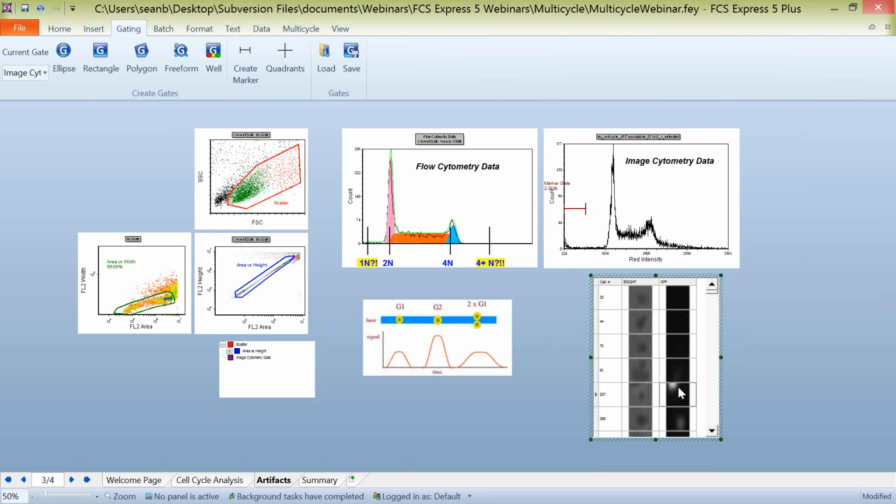We have another case here where a piece of a cell is actually being cut off. Another one here where a piece of cell is being cut off. So these are probably things that you'd want to exclude from your DNA analysis if you're working with image cytometry data. Now, conversely, if you look on the higher end here, you can see that many of these cells are actually overexposed. So we'd want to exclude them from the analysis because we don't have that directly proportional link between the fluorescence data and the DNA content of the cell because they've just been overexposed.